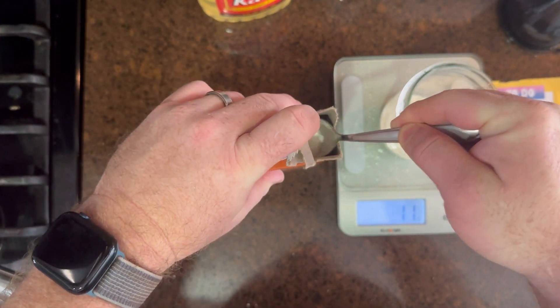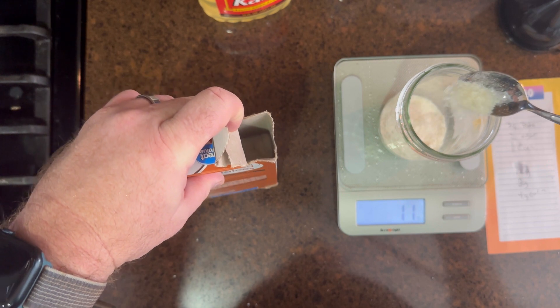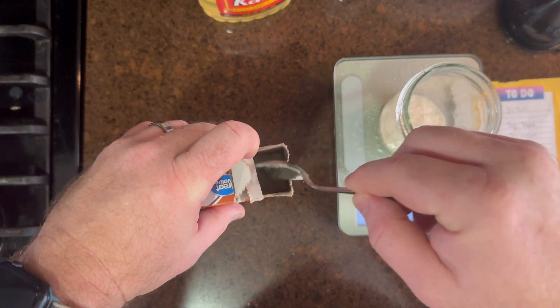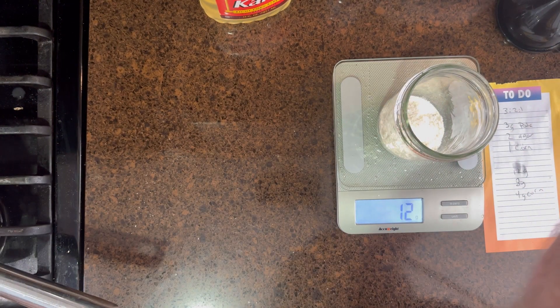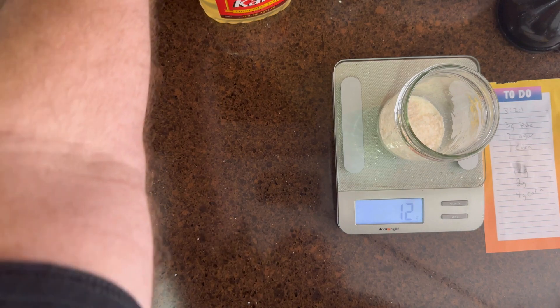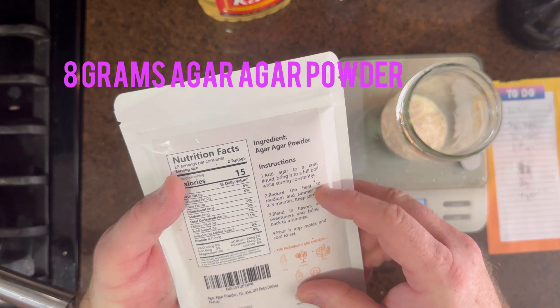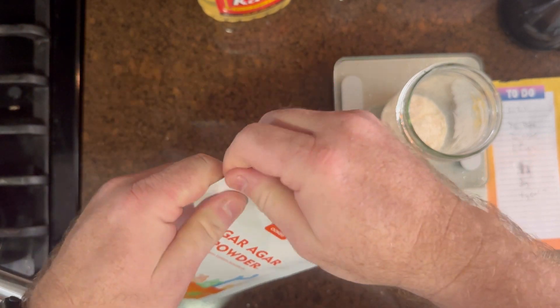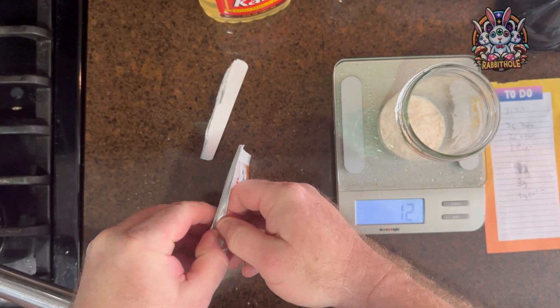Overall this was an easy project — I think I spent about an hour doing it all said and done. As you saw in the intro, I produced 25 cups. I could have gotten that a little higher or lower; towards the end I probably started dumping them a little heavier than I should have.